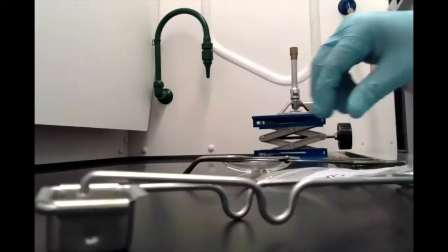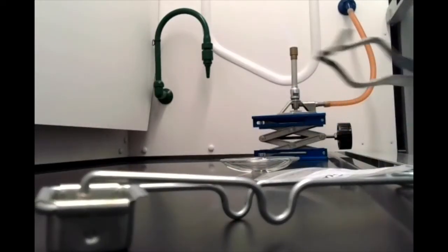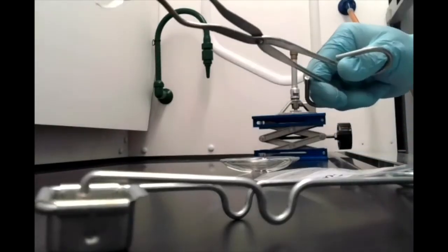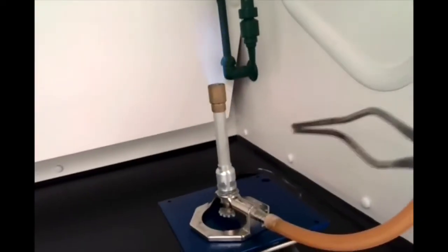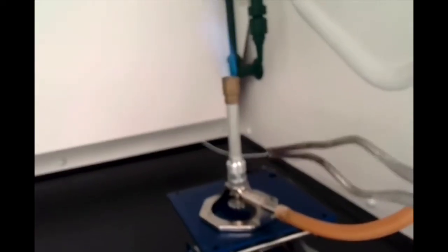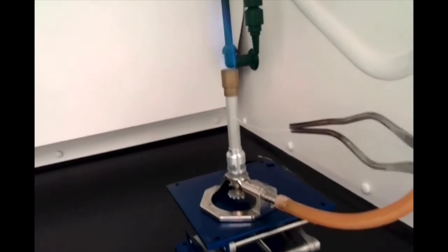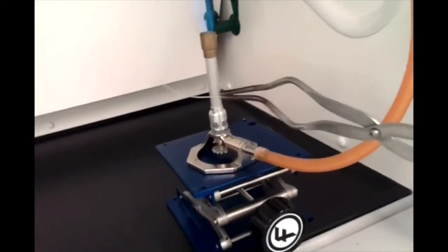Okay. And we're going to use that to ignite our magnesium metal. All right, so I'm holding it here in a pair of crucible tongs, and I'm going to turn off these lights and let you observe what happens when we set this magnesium on fire. Now, normally, if we were doing this in person, I'd tell you not to look directly at this magnesium. It's going to burn really brightly, and that's bad for your eyes. But since you're viewing this through a camera on a screen, it should be okay.